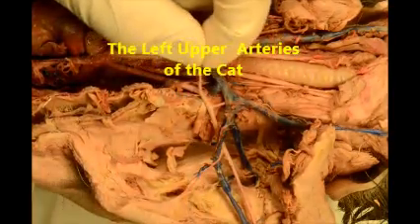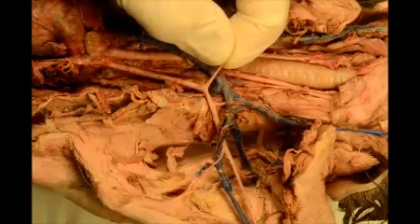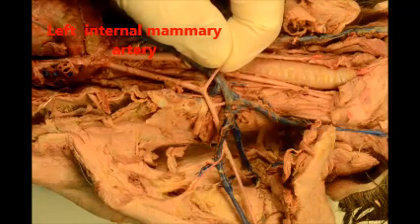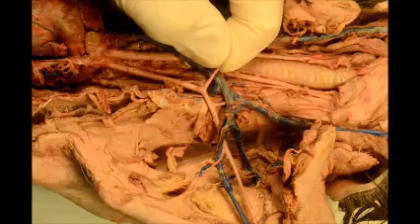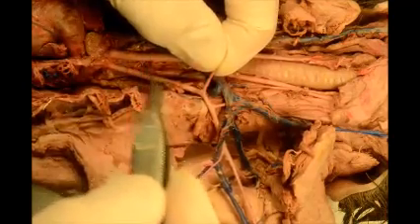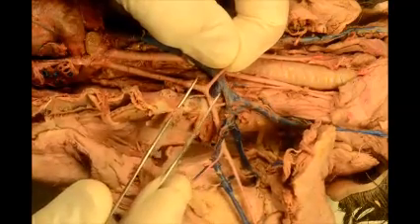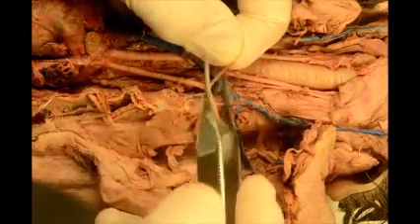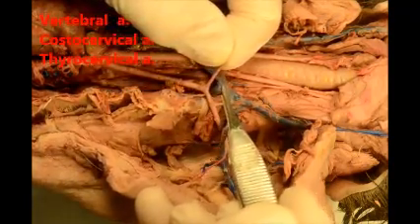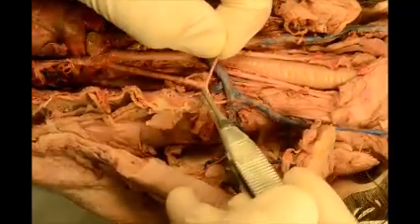Here we are on the left side of the cat, and my left hand is holding the internal mammary. Once you know the right side, the left side is the same after the brachiocephalic, starting with the subclavian. The subclavian on the left side is here, and again in my hand is the internal mammary. You can find VCT easily because it will be within one inch — here's my marker, one inch there. Here's V, which stands for vertebral, and vertebral is here. Over here is costocervical, because costo stands for rib.